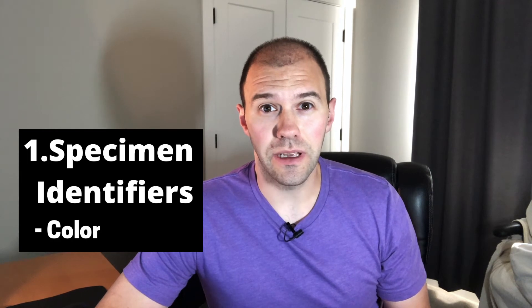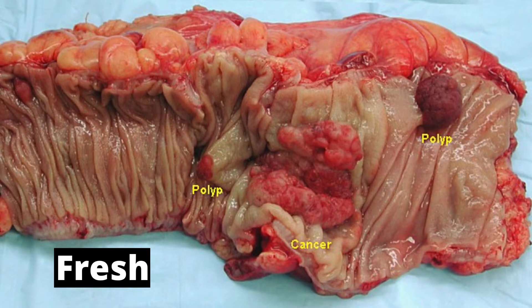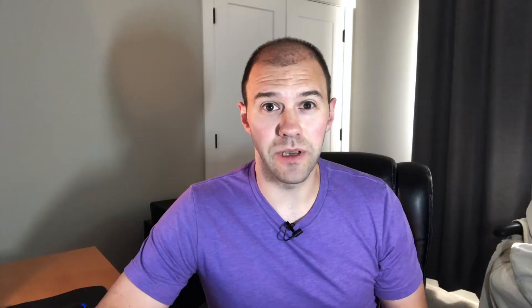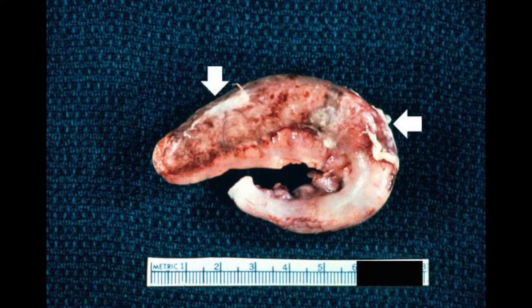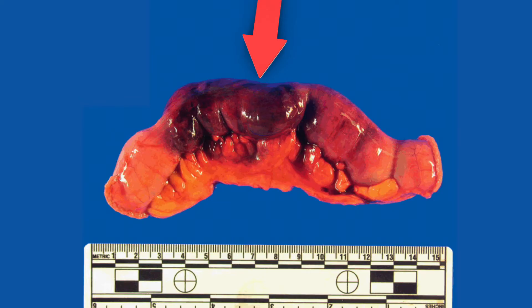The next thing is color. For the most part, tissue is either a light tan or gray, depending on whether it's fresh or fixed. If there is greenish or black discoloration, that might indicate some kind of mummification or necrotic process. White discoloration could be fibrin or tumor involving a serosal surface. Deep reds or purples are often hemorrhagic or congested — so these are things you want to note in your description.